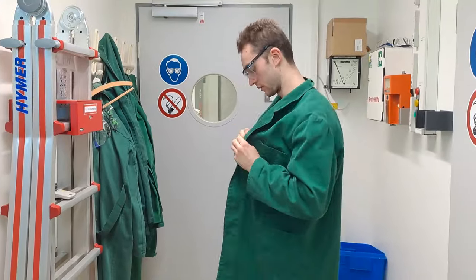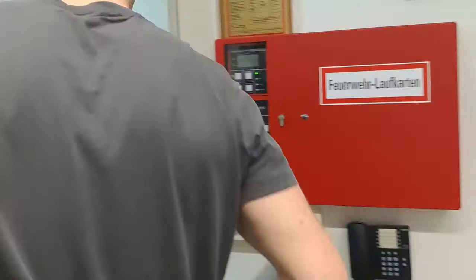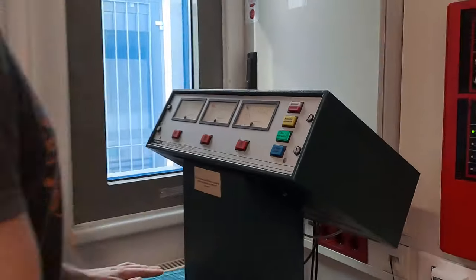Now that the laboratory work is done, you can take off your lab coat and measure yourself for radioactive contamination. After 30 minutes, you will have a spectrum.